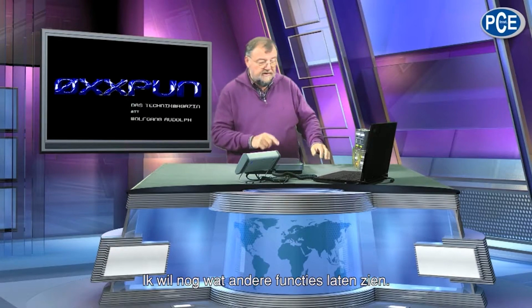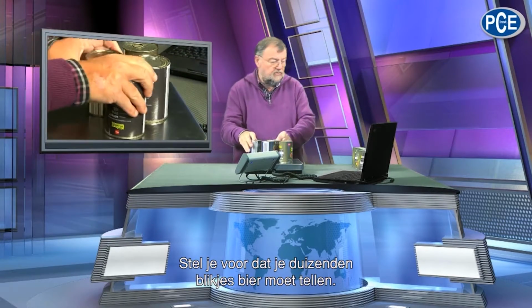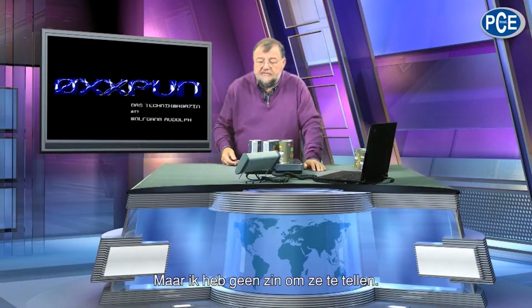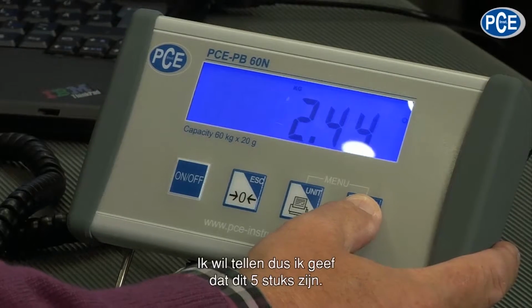There are other functions and I would like to show you them. Try to imagine I have cans here. I have thousands of them and I have to count them. And I cannot be bothered to count them. Then I tell my scale, watch this, I would like to count now.